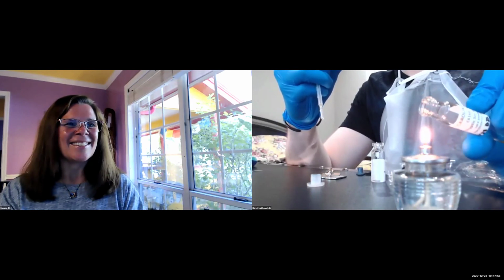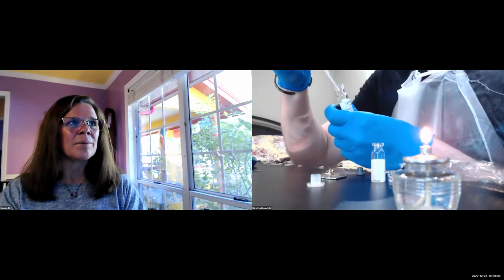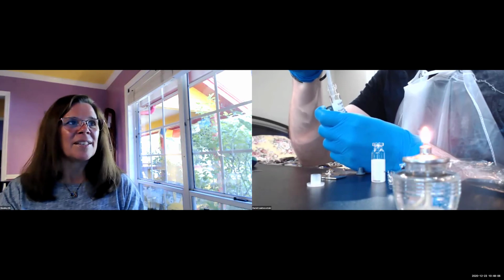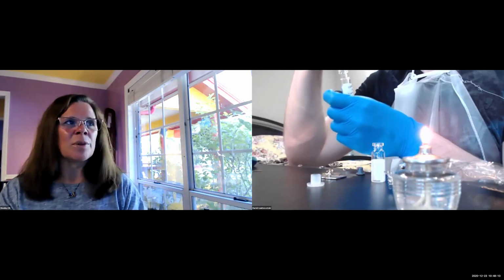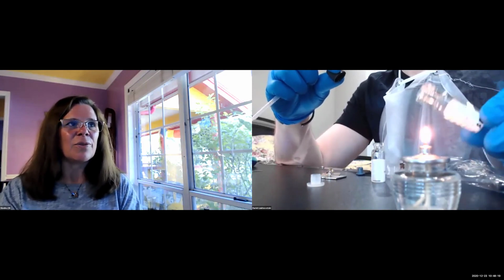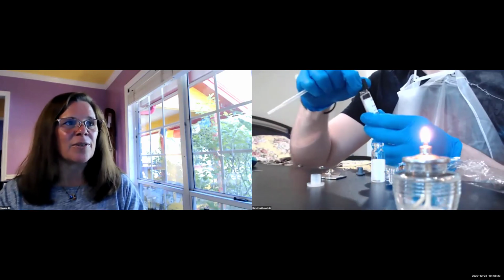Excellent. We're transferring everything here. Perfect. And is it one more time? Flame it again after the transfer? Always flame it before and after every transfer. And then we just completely successfully did an aseptic transfer of a culture, rehydration and aseptic transfer.